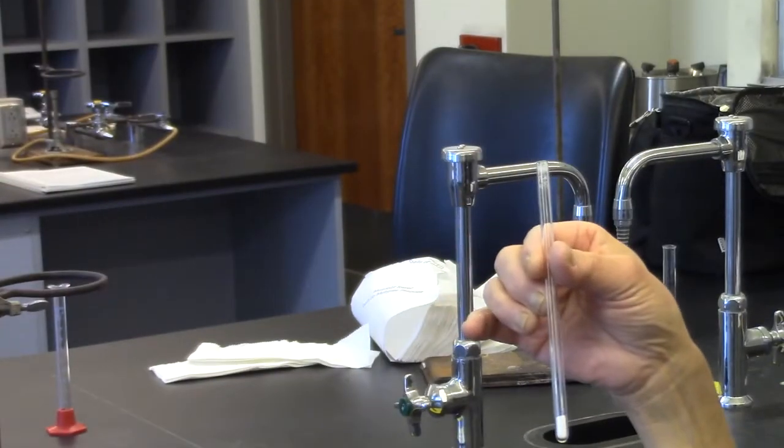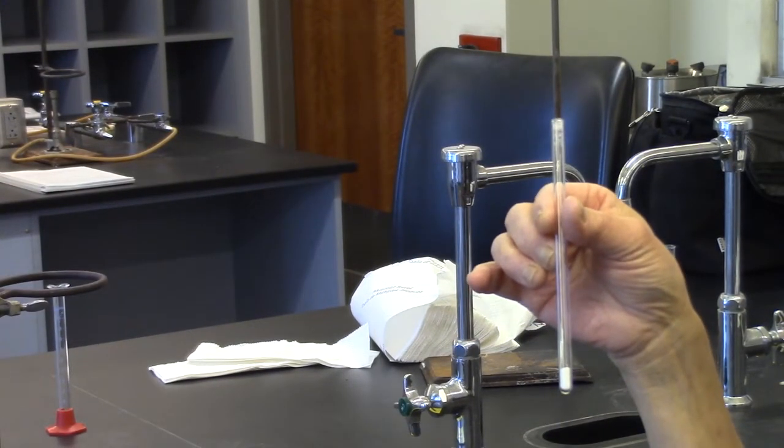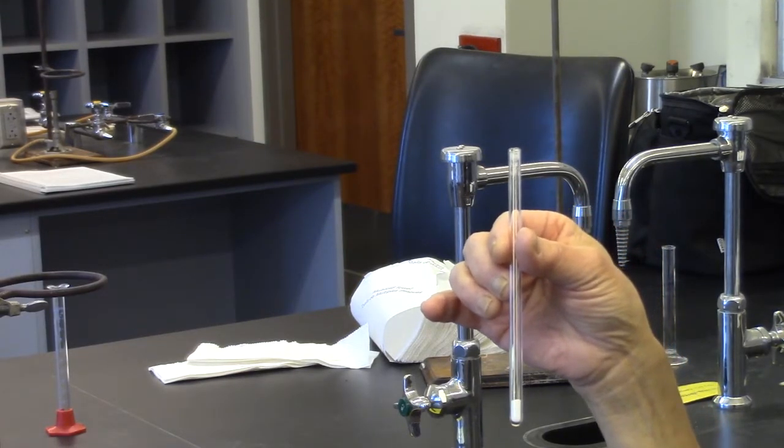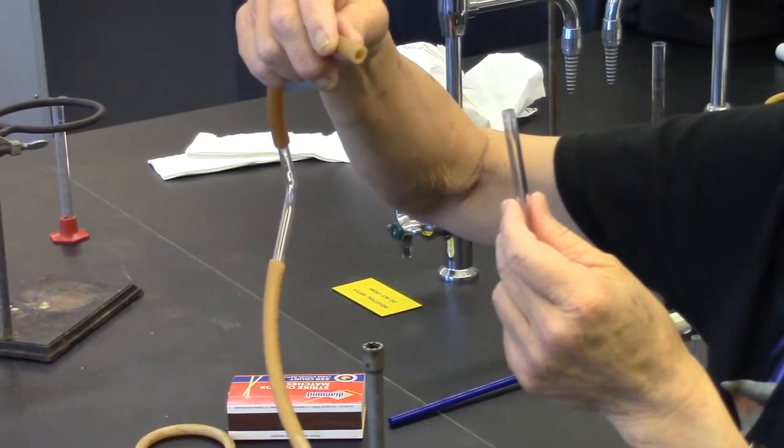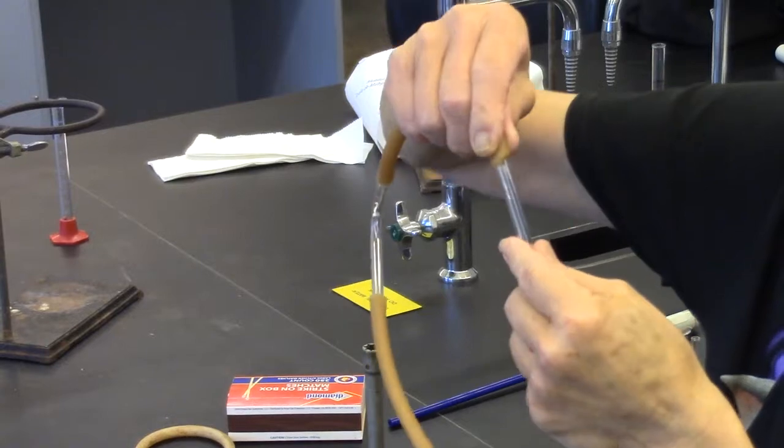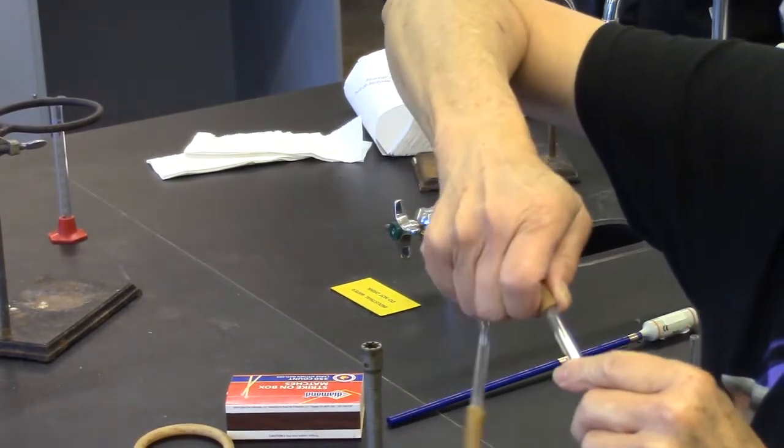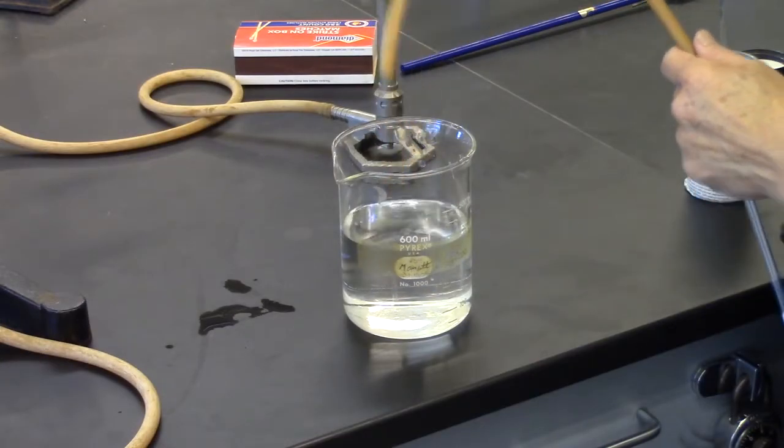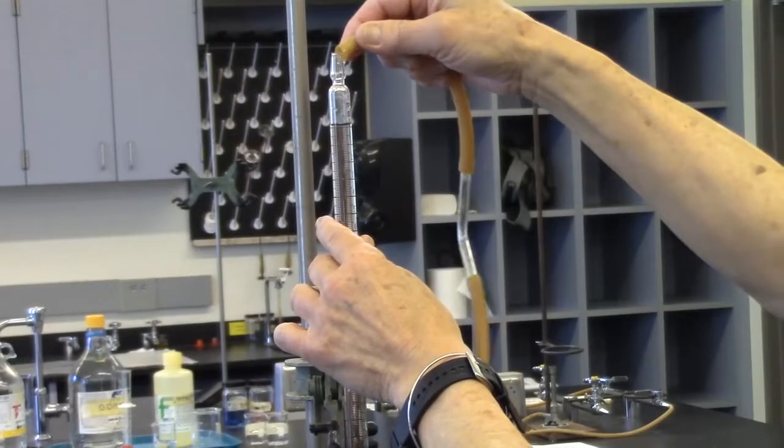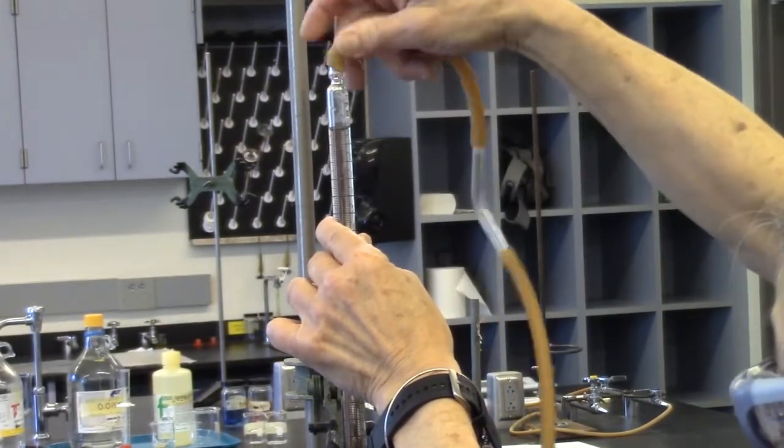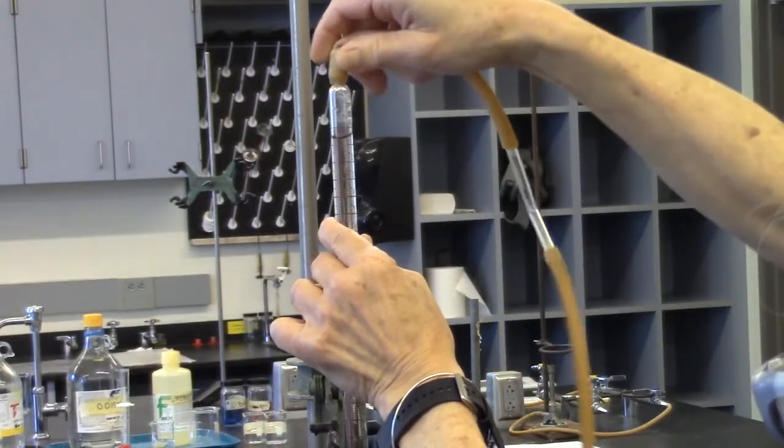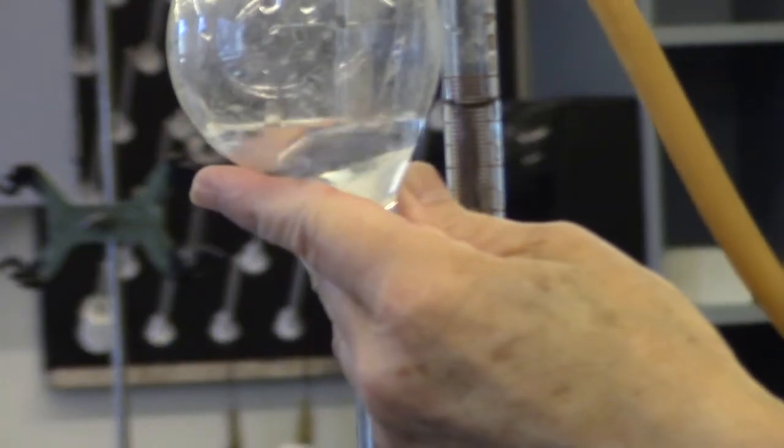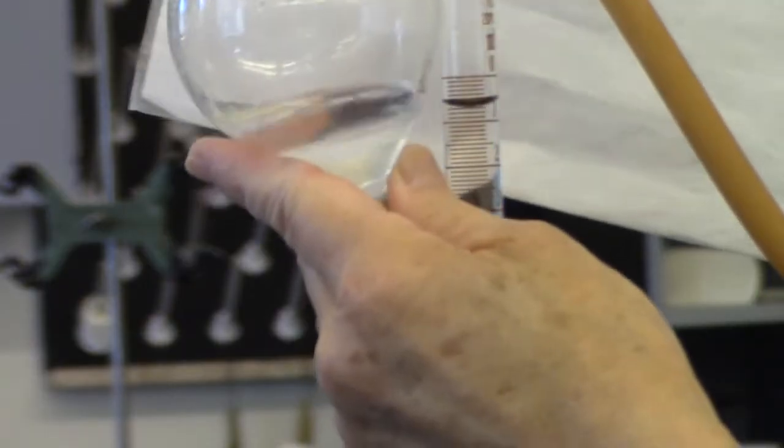Now that the reaction tube contains potassium chlorate, go to the analytical balances and weigh this. You do not need to weigh the empty reaction tube. Attach the reaction tube to the rubber tubing on the bent glass tube. Dip the other end of the rubber tube into water to facilitate attaching. Be careful not to get the bent glass tube wet. Attach this to the top of the water manometer. The water level should be between 0 and 1 mL on the manometer.